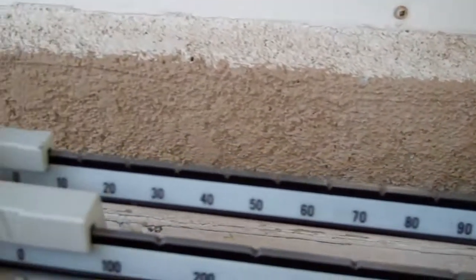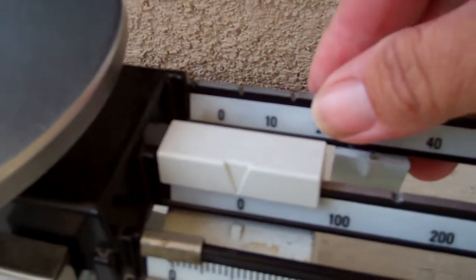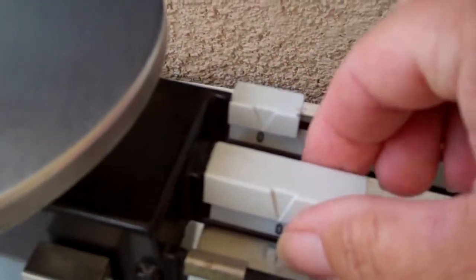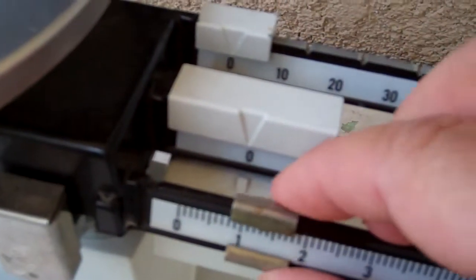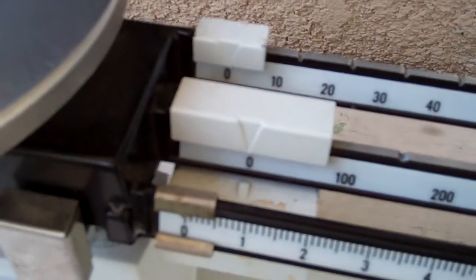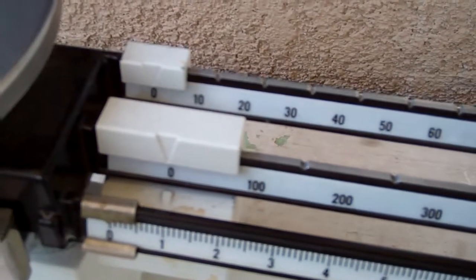When you're doing that, make sure that all the riders, these are the riders, are on zero. If they're not all on zero, then you can't start measuring yet. So make sure those are all on zero.